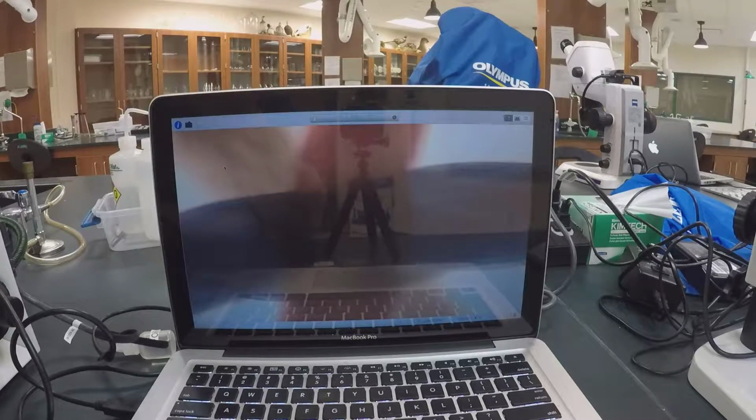So for example, let's say we're looking at a plant leaf, and we're looking at the top layer of the plant leaf. Okay, that's where the epicuticular layer is, and then we're interested in magnifying that epicuticular layer, but instead we look through the epicuticular layer and we're looking at the bottom of the plant leaf now. Well, that's where the stomata or the pores are. Okay, and so you might think, okay, well, there's pores on the top of the leaf, and majority of leaves do not have stomata on the top of the leaf. So it's important to know where you're at, what plane are you looking at when you're examining an object.